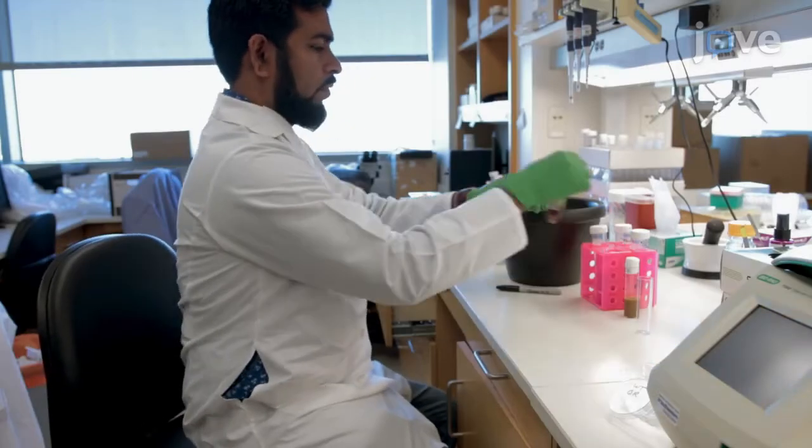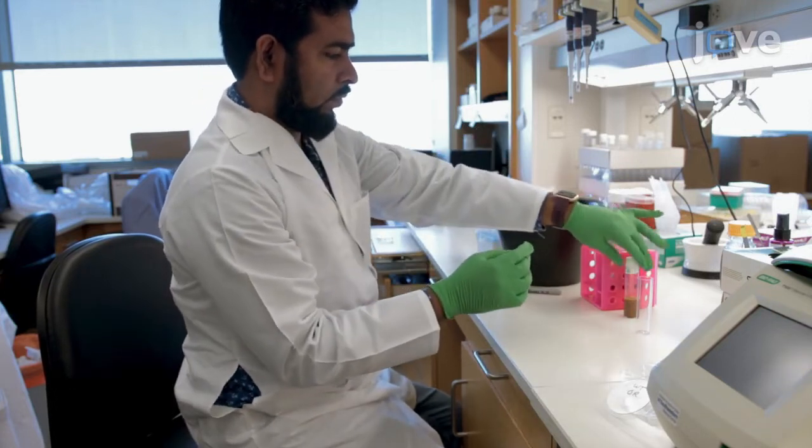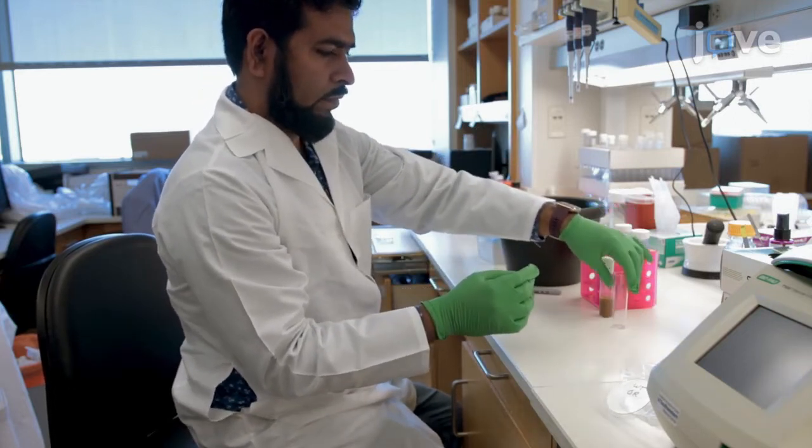Start arranging for the gut acidification monitoring assay with the preparation of the fly food with pH sensing bromophenol blue or BPB dye.